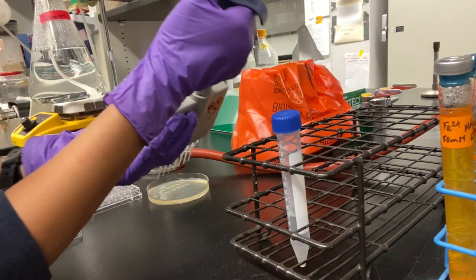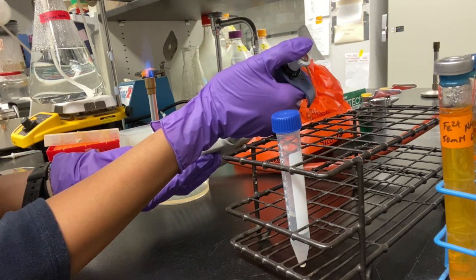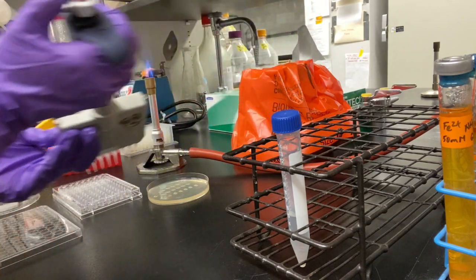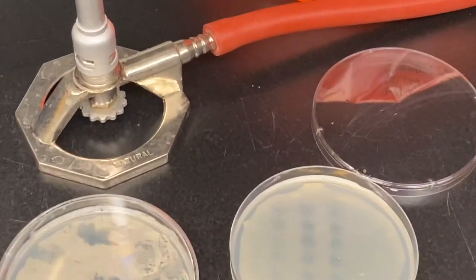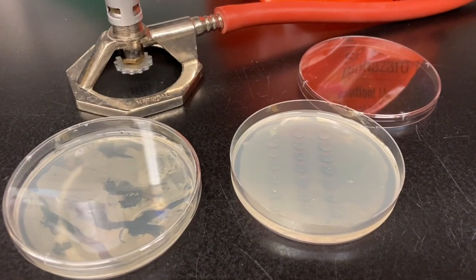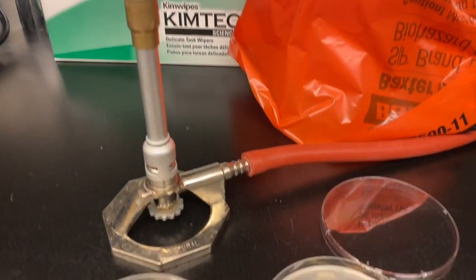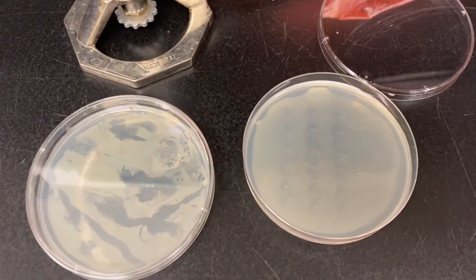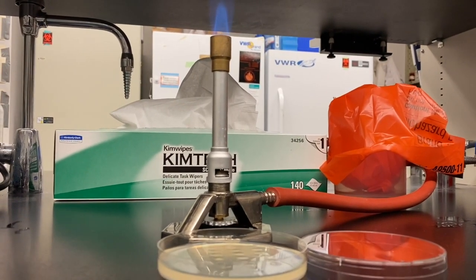Using a fresh set of tips, we can also plate 10 microliters of sample 2 and sample 3 onto the same plate, very carefully so that our serial dilutions are parallel. Be careful not to move the plate so our dilution series do not run into each other. The most heavily concentrated spots will be towards the top with a dilution of 10 to the minus 1, and the least concentrated will be towards the bottom with a dilution of 10 to the minus 7. Leave the Petri dish open to dry. It may take more than 20 minutes.